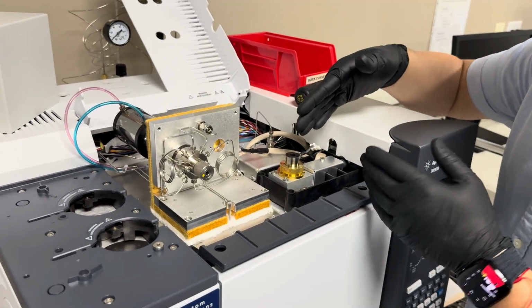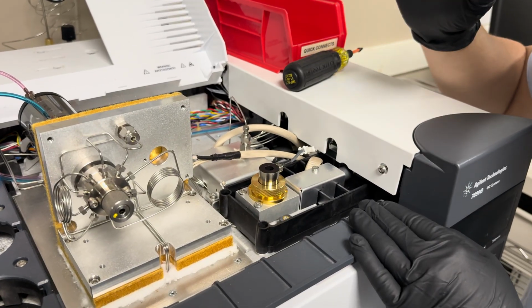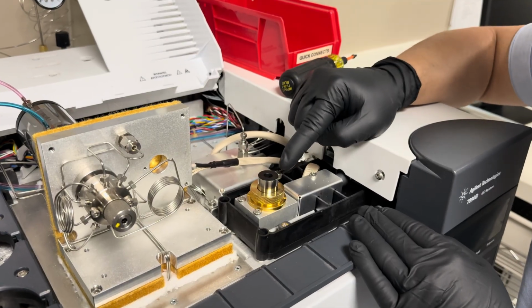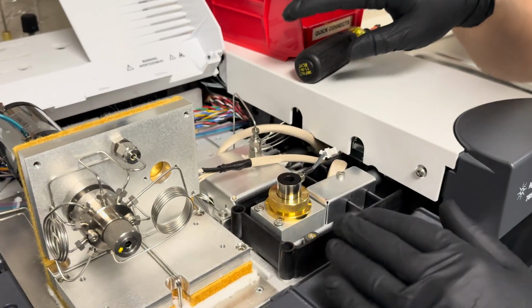Okay, so I'm gonna show you how to remove the collector assembly from the FID. The first thing you want to do is make sure to cool down the FID and turn off the flame jet going through your GC. This one's obviously turned off.